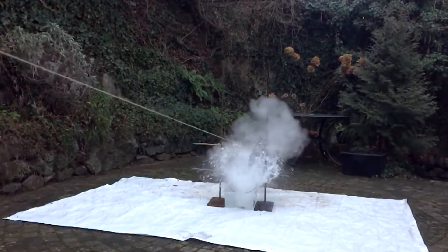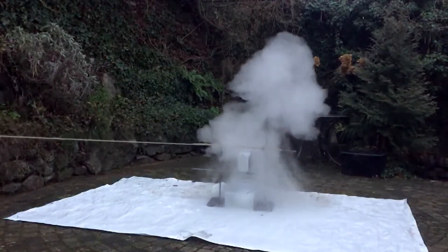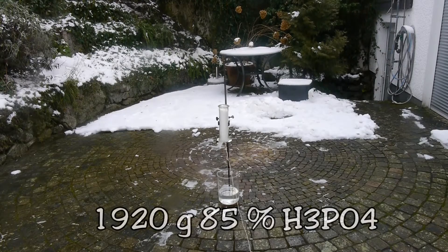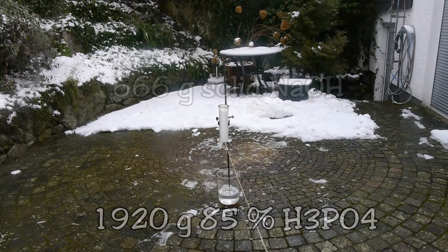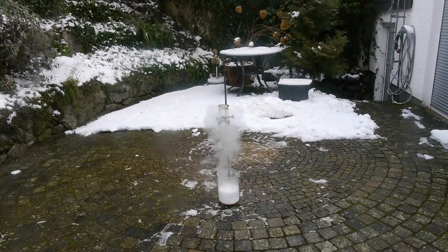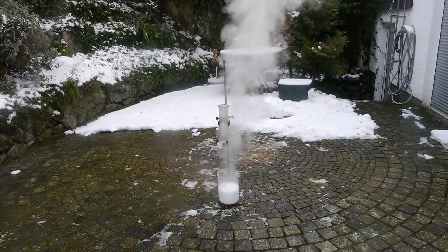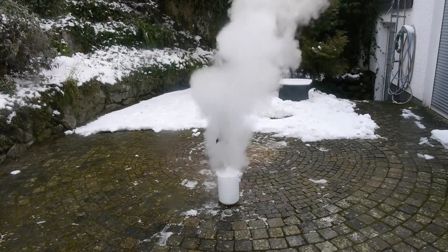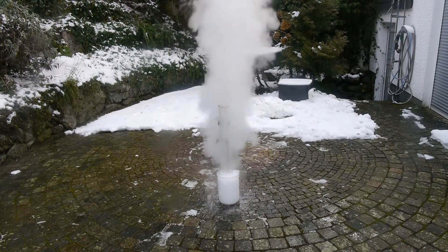Before, it was just a slow solid-state reaction, and in solution it proceeds much faster. This is 1,920 grams of 85% phosphoric acid and 666 grams of solid sodium hydroxide. The high viscosity of the phosphoric acid and the solid state of the sodium hydroxide made the reaction really slow.